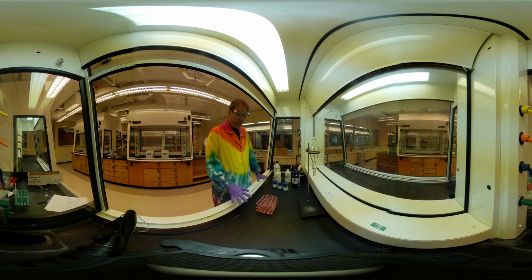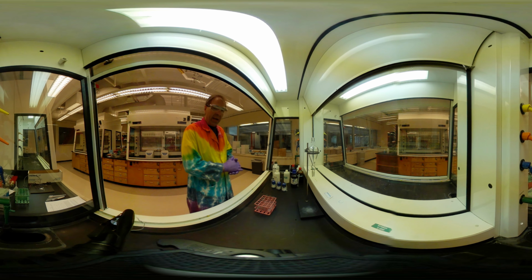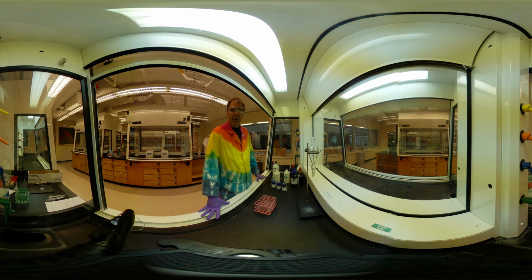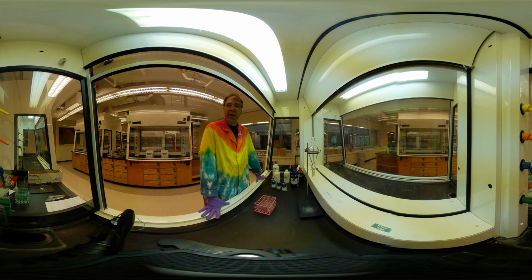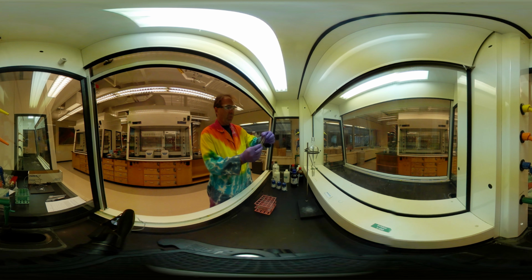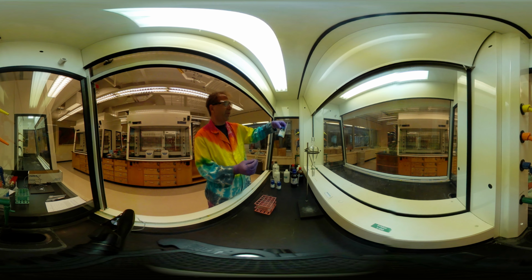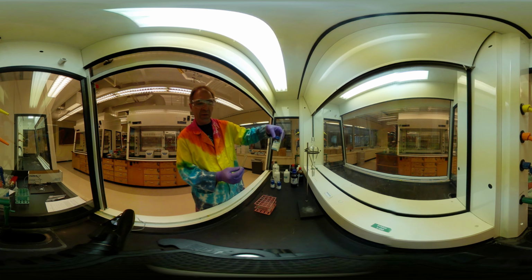Okay, so what I've done now is I've gone through and I've mixed all of my solutions and I've let them sit. All right, so let's look at the results of our solubility tests. I'm going to go across the top row here, and you'll need to record this data in the question that's coming up. What we're looking at is the overall solubility in different solvents of the ethyl 4-amino benzoate.